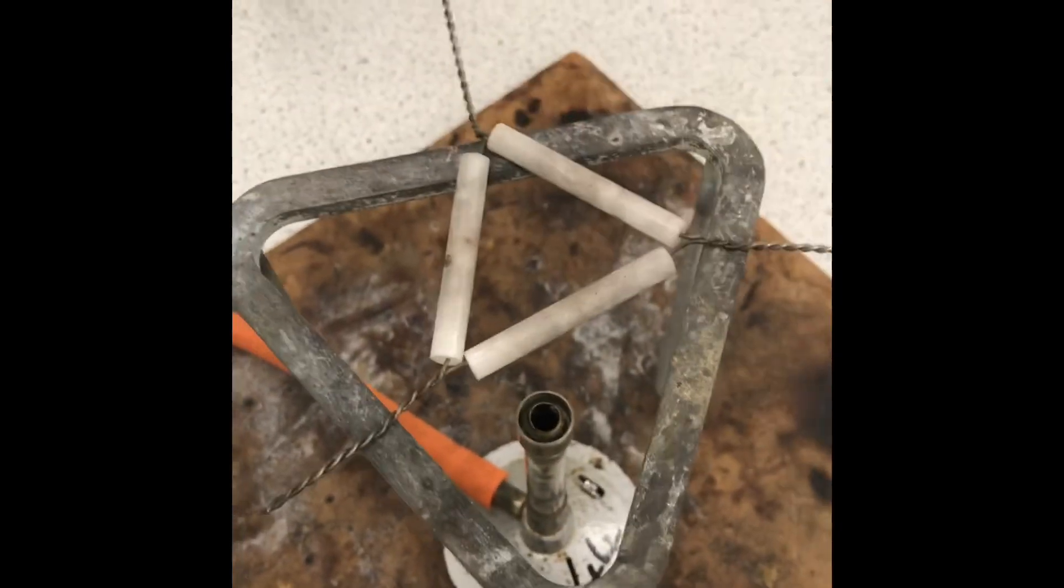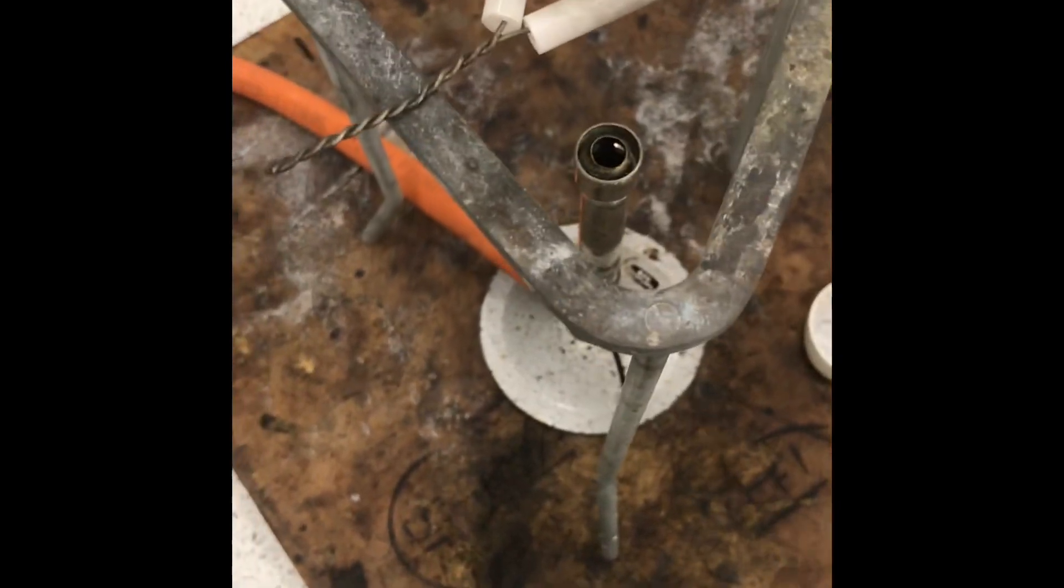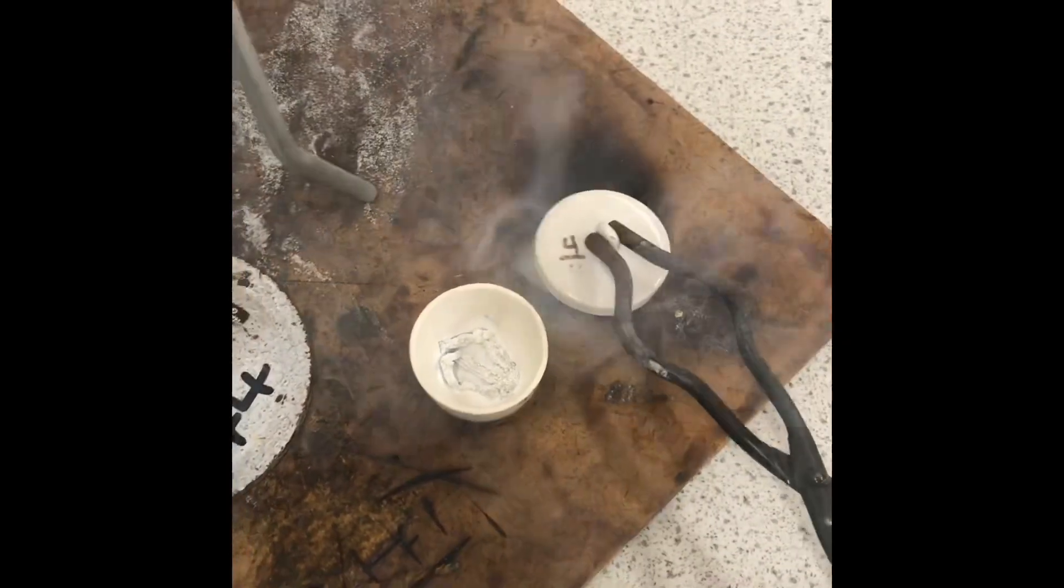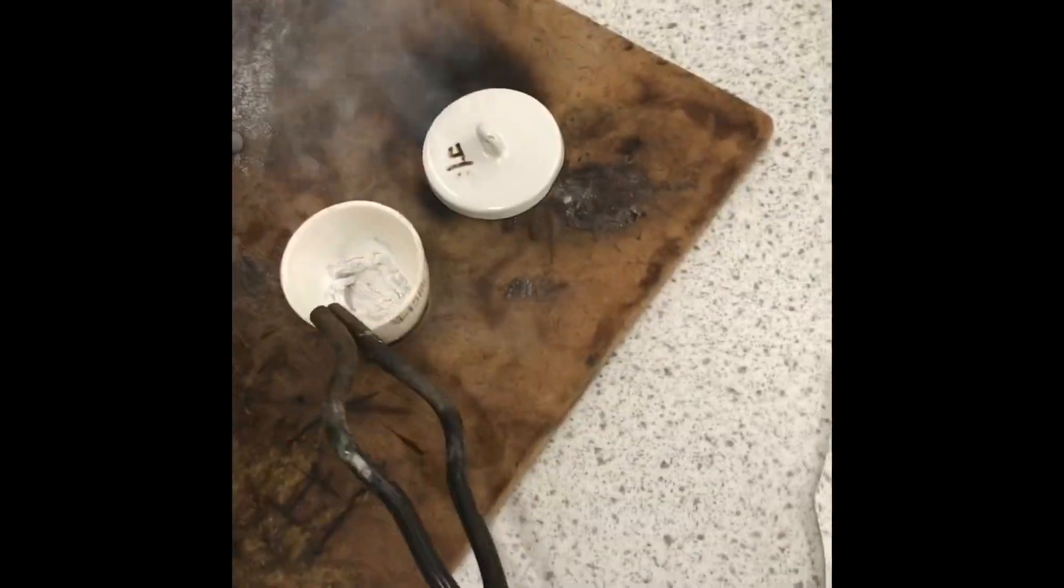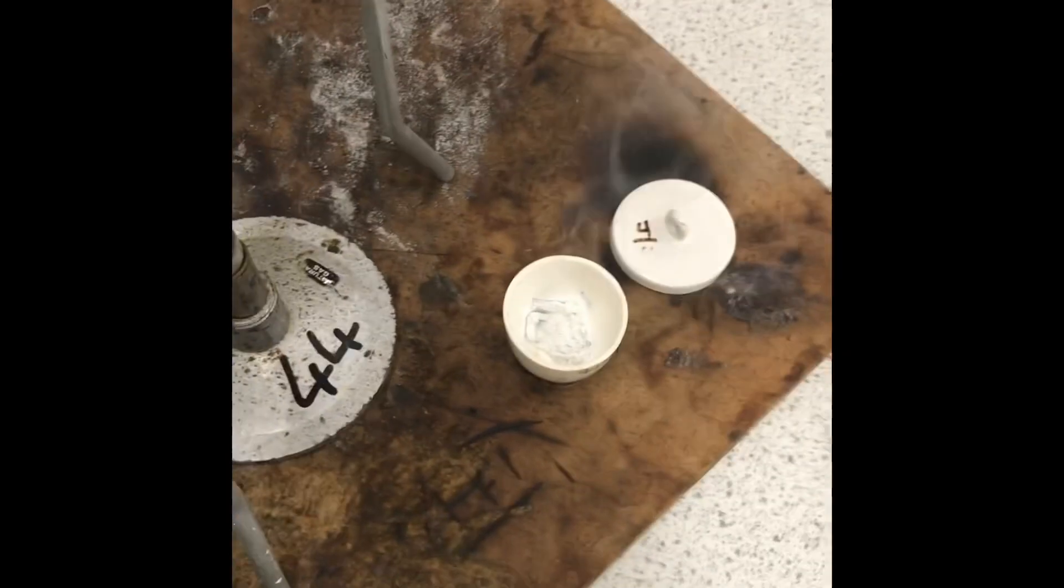It's important I use tongs as to not burn myself. Once this magnesium oxide is cooled, I can then weigh it using the weighing scale.